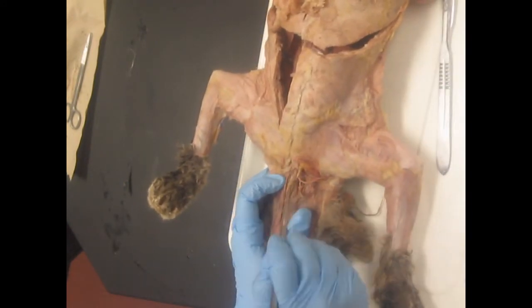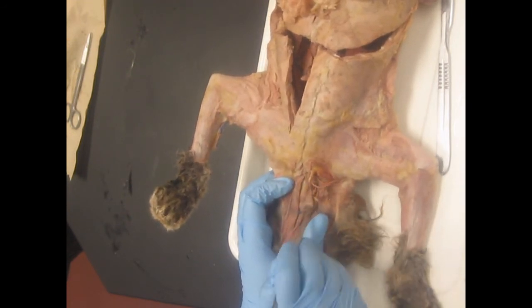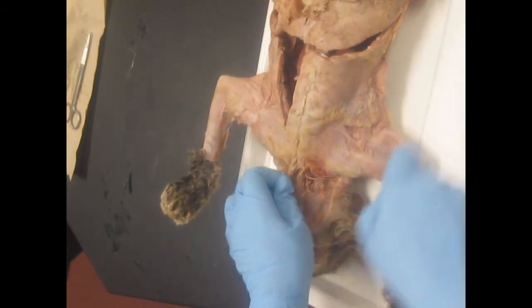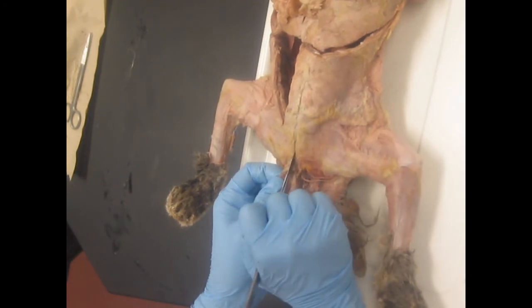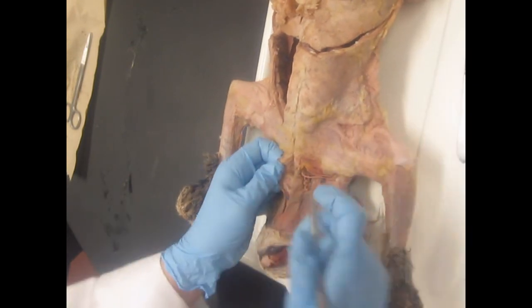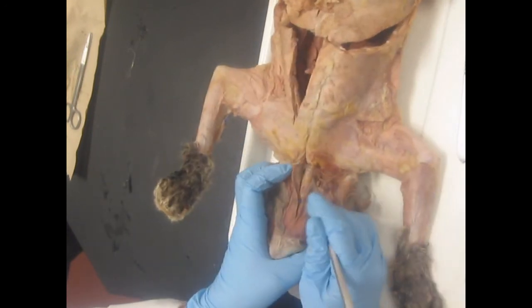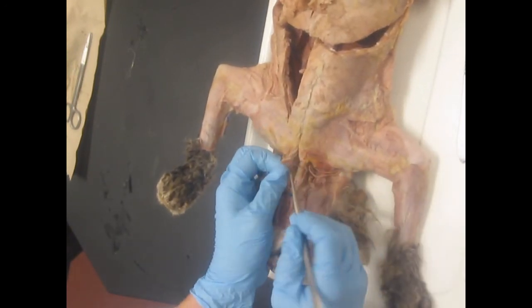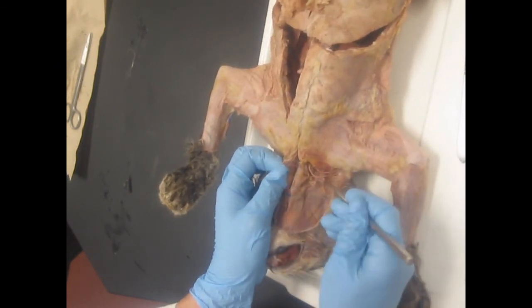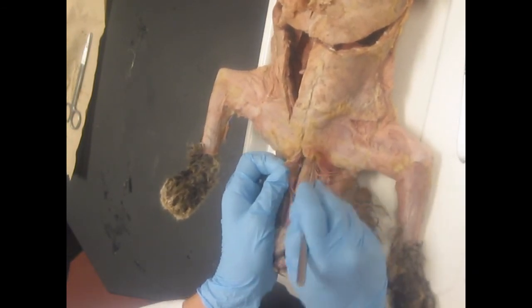Now, this tube is what we're looking for. That's the trachea. It's a ribbed white tube. We want to get enough muscle off of that that we can readily see it, and then we'll find the thyroid. Light incision. You also don't want to go too deep in this area because those are going to have some vessels of the cardiovascular system you're going to be responsible for identifying later. Okay, now once I find that tube, I'm going to use my blunt dissector tool and just run the probe along that tube, and that cleans off the soft tissue.